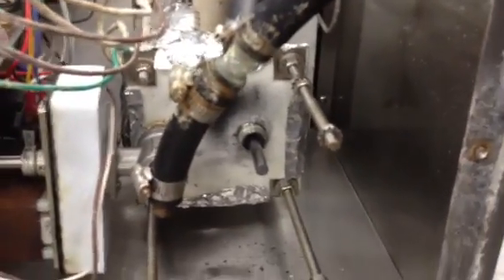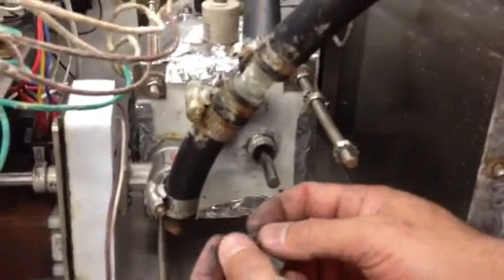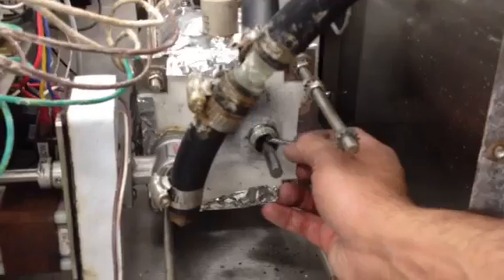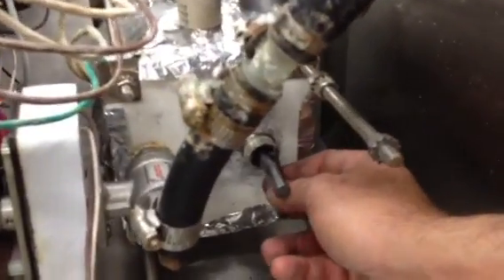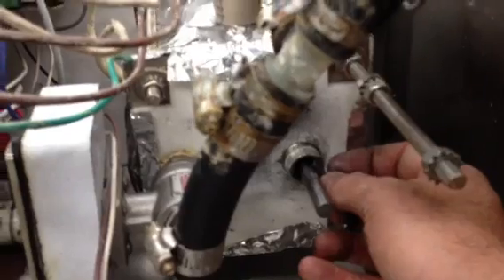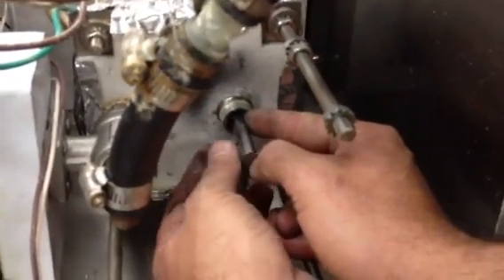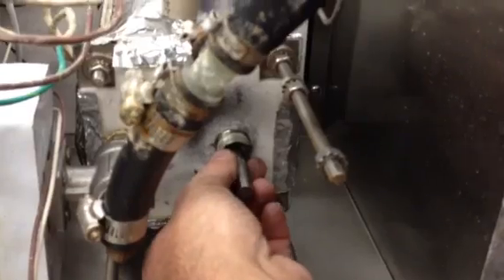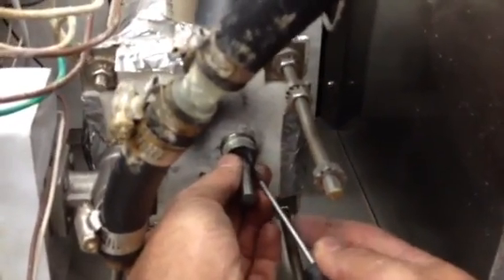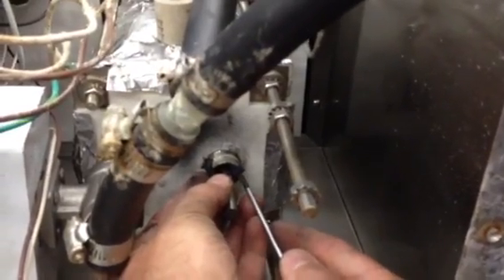And the last piece of rope, basically you want to start this one the same way, but our last piece of rope we started here, so you want to stagger your seams on the rope, just to help with leakage in the future if it's not tightened correctly. Basically start this the same way we did the first one. Basically we're going to do the same thing and work our way around.